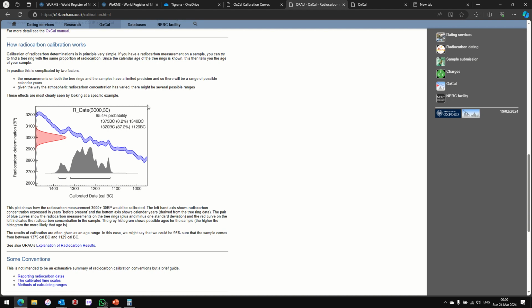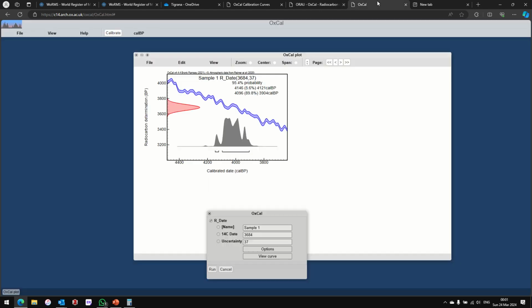And I don't see any y axis here, number one. And even if it is concentration, and I imagine a secondary y axis here, I would expect this to be one straight column, like the number of sales in a particular year would be one column. So I don't really know how to interpret this. And it says the blue curves show the radiocarbon measurements on the tree rings, plus and minus one standard deviation. So I'm getting the exact same curve, no matter which sample I run. So I don't know what I'm doing right now.